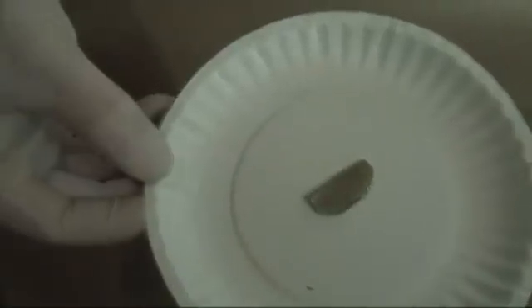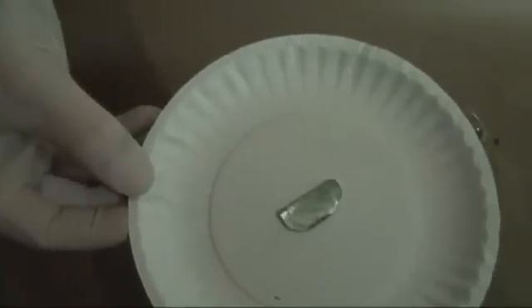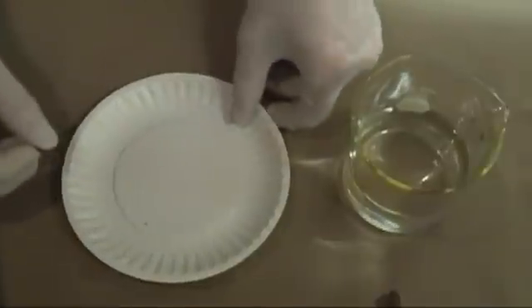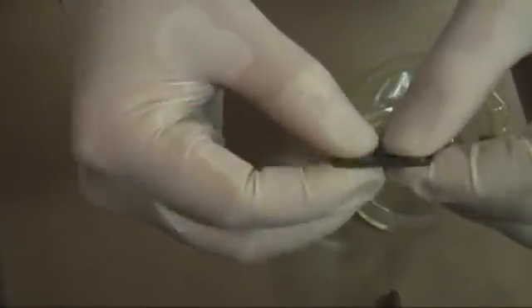To begin we will need about 4 grams of terbium metal. Mine was donated by KimKidDepot.com. You'll also need some dilute sulfuric acid. Here's a closer look at the terbium metal. It is a silvery white rare earth metal that is supposed to be malleable. I didn't find it to be all that malleable. It could be that I'm just weak.